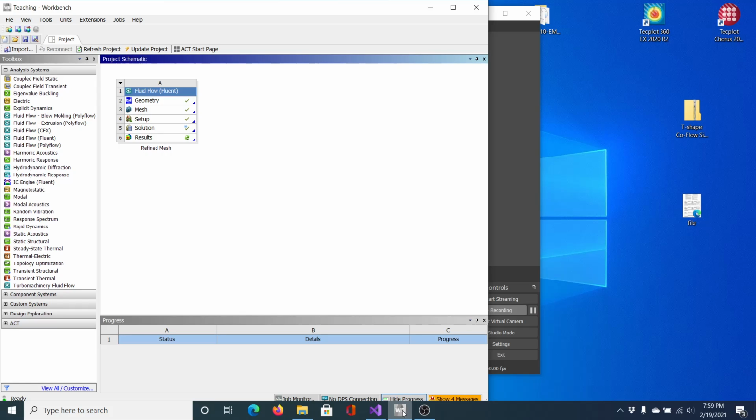But if you've done all the last steps, you probably encountered some errors, maybe something called a floating point error. And I'm going to go over a few ways to fix that. The first method I'm going to show you is not the ideal method as far as accuracy, but it should work as far as getting some solutions.